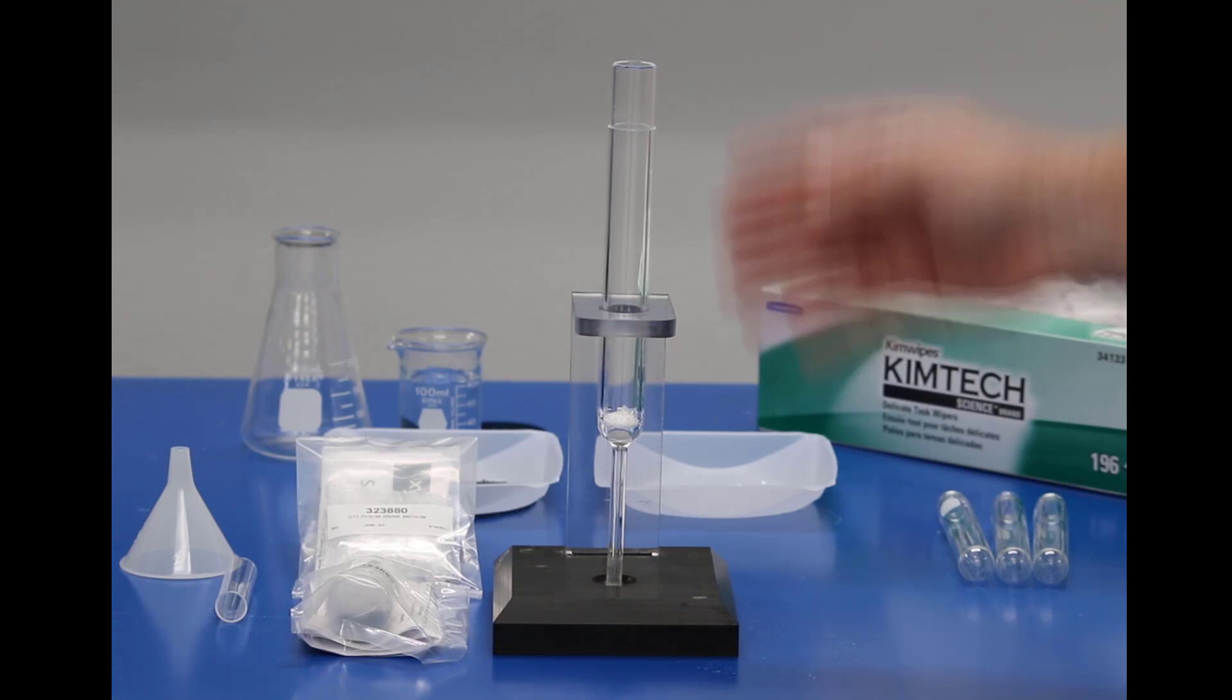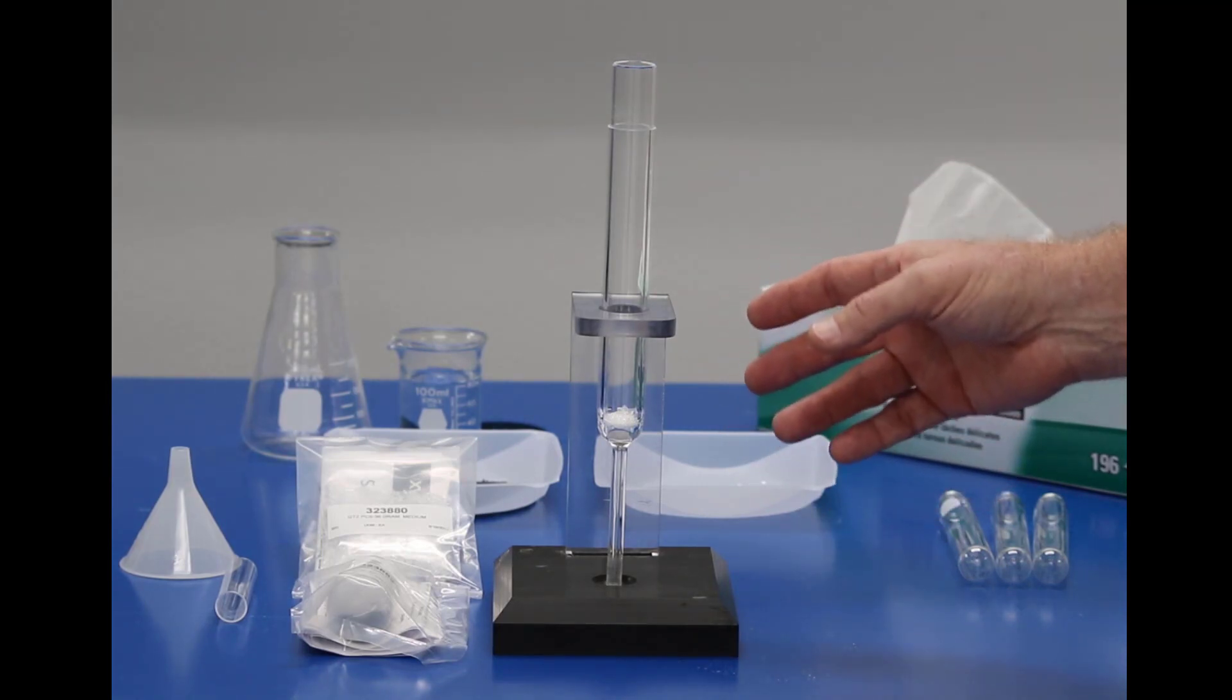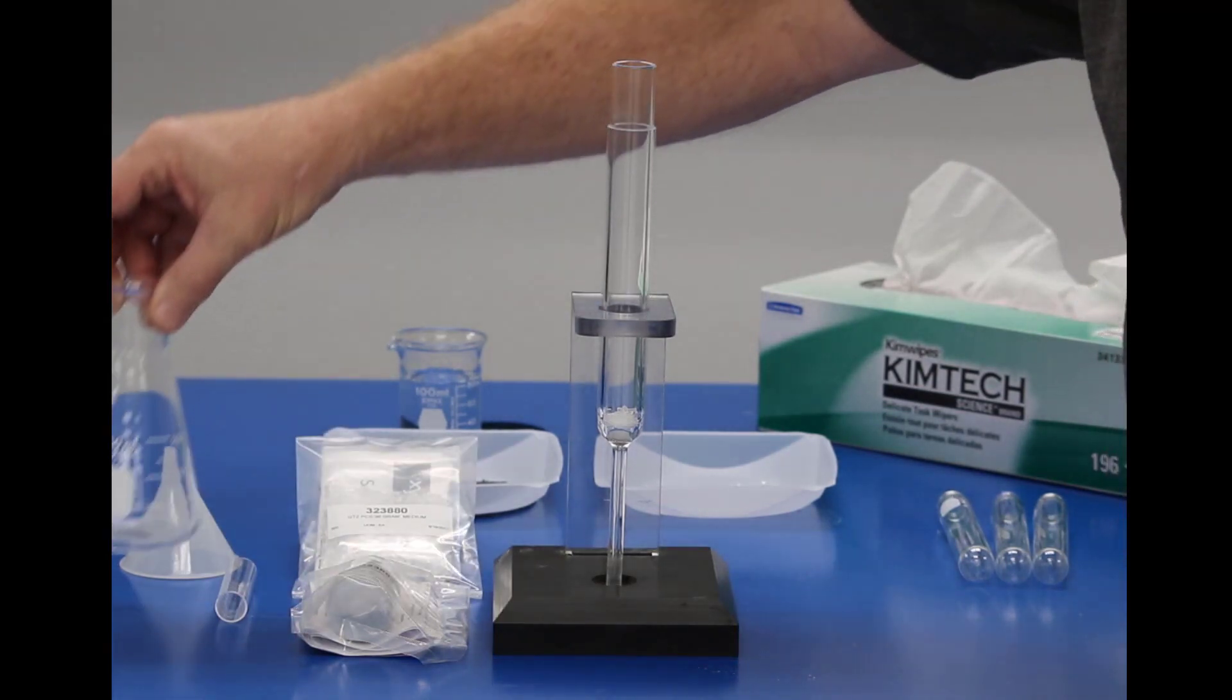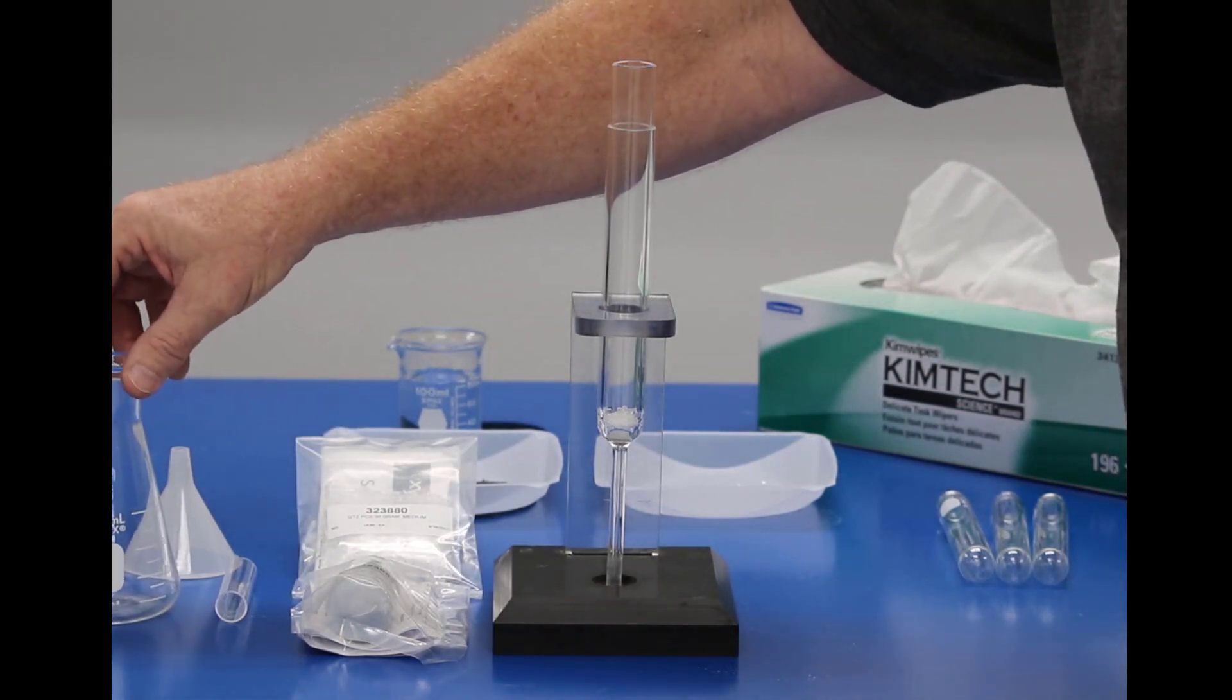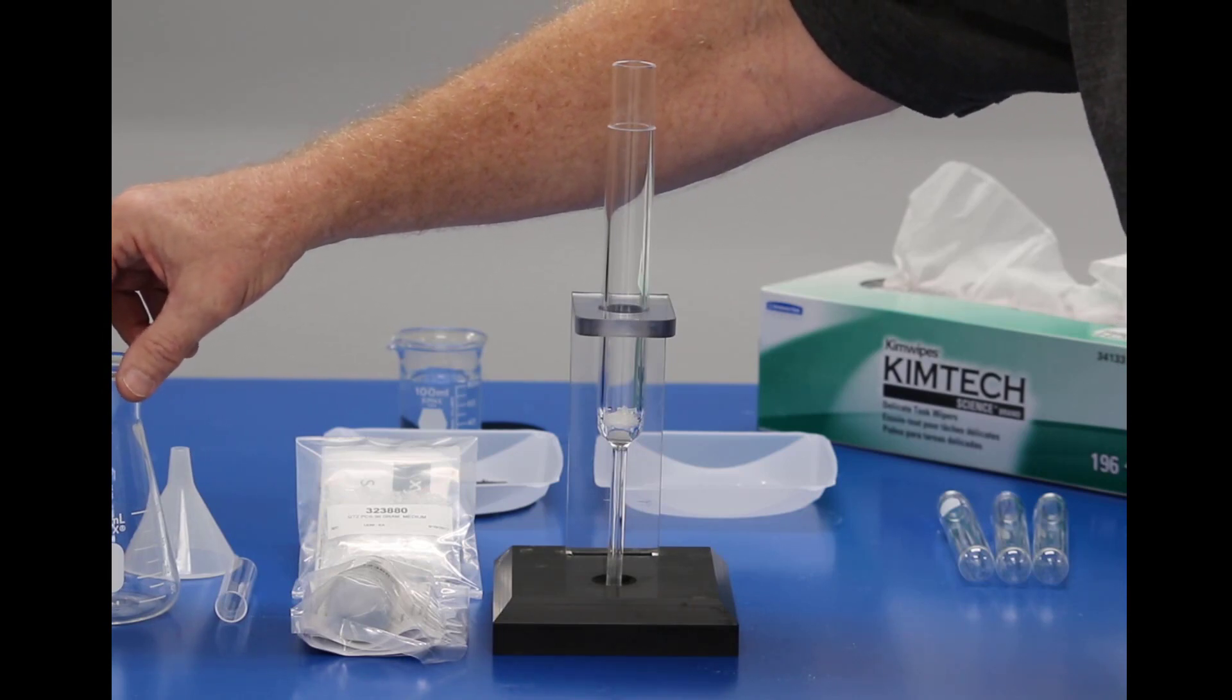I have my tube resting in this holder. If you don't have anything like that available, then a 250 milliliter Erlenmeyer flask or a beaker of approximately the same size works well.